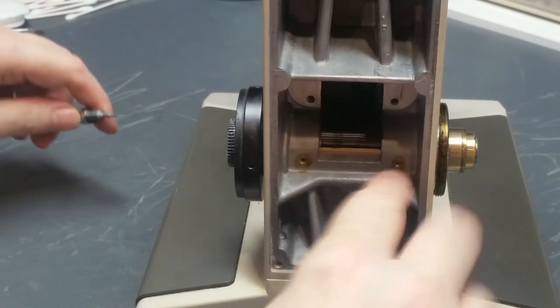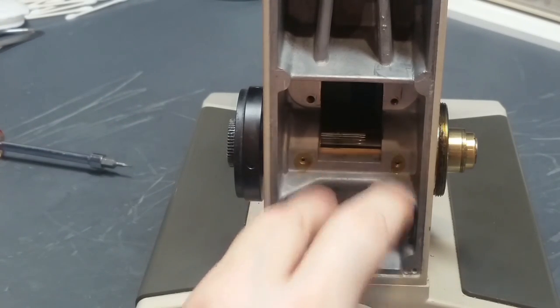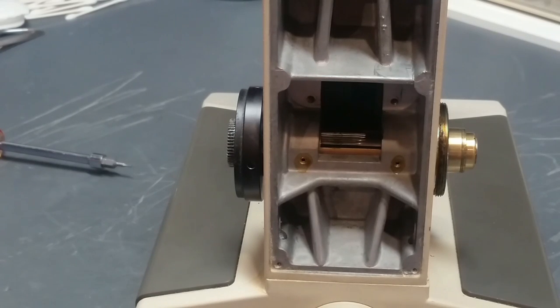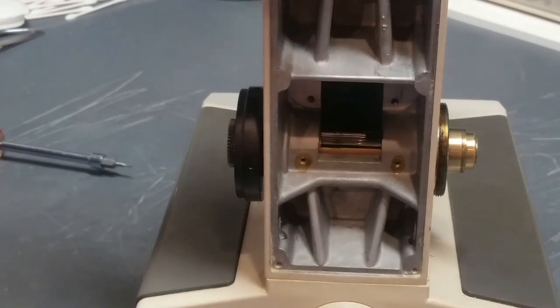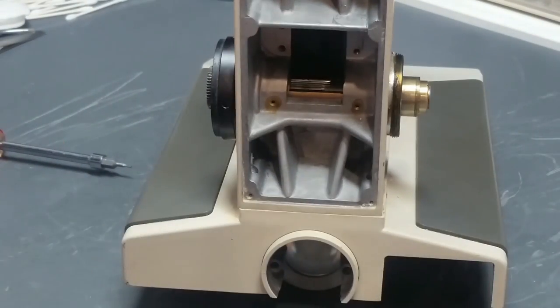We've got two set screws here that are really hard to get out of here. The best way that I've found to do that is to start with a bit of acetone and put a drop of acetone into the heads of the two screws. Let that work for a few seconds.